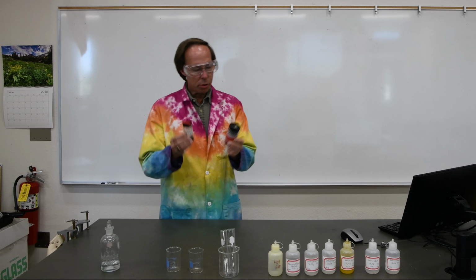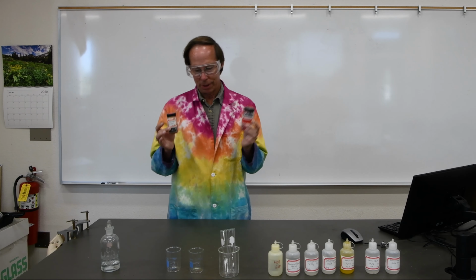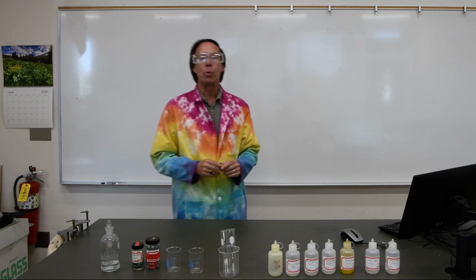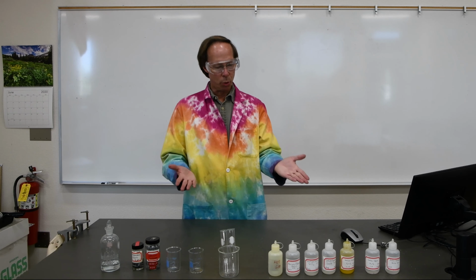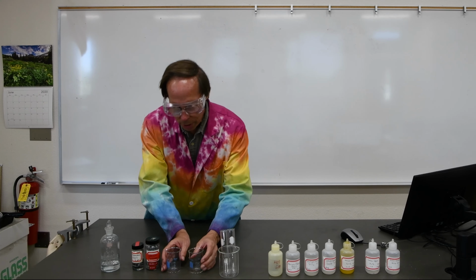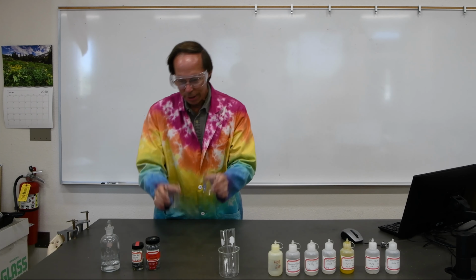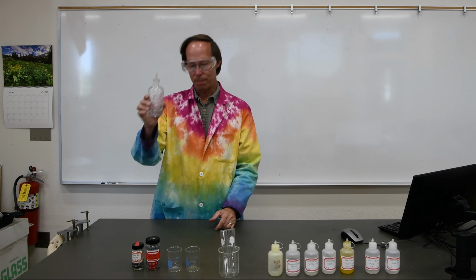First of all, we're going to determine which of these two elements is the more reactive. Secondly, we also want to react them with hydrochloric acid to produce magnesium and calcium chloride, which we're going to use in the second part of the experiment. So in the first part of the experiment, we're going to be weighing out a small amount of magnesium and calcium in 2 beakers, and then adding to that some hydrochloric acid.